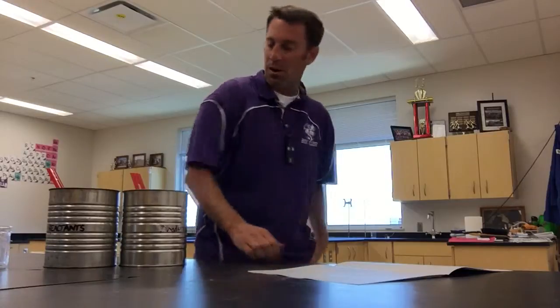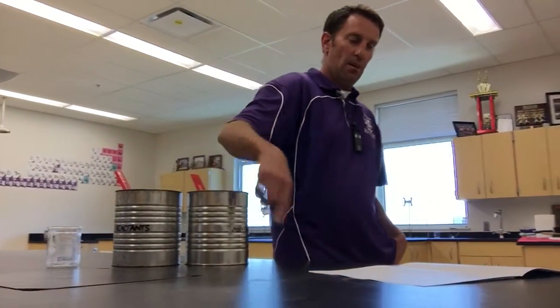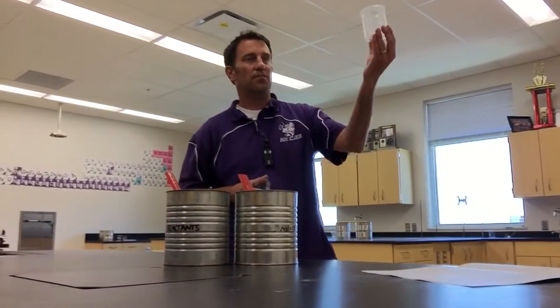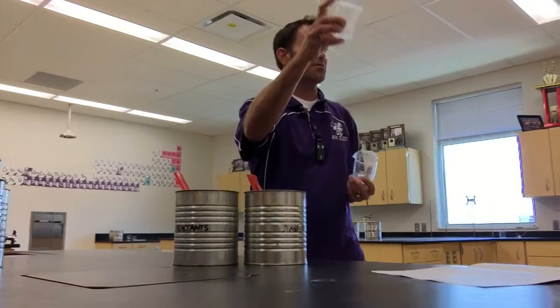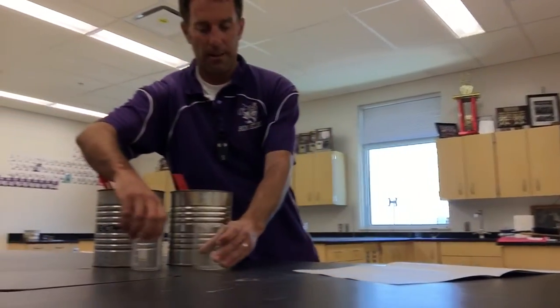All right, we're going to put water in cans, label products and reactants. Did I point to that the right way? You will use the appropriate size beakers. So in this lab we have a 250, the big beaker, and the 150, that's the small. Small goes into the, yeah, it's not that hard to figure out.